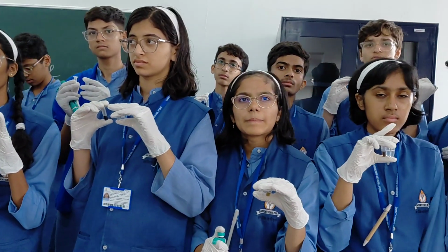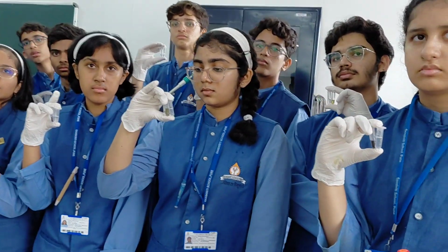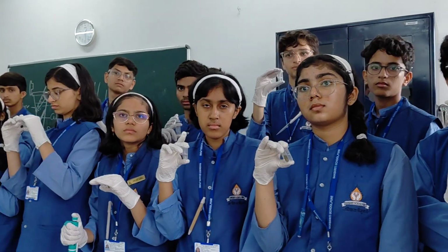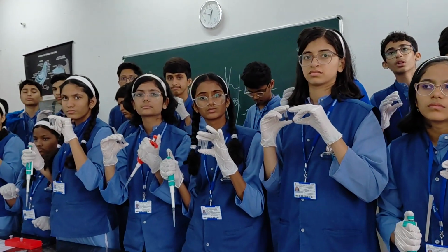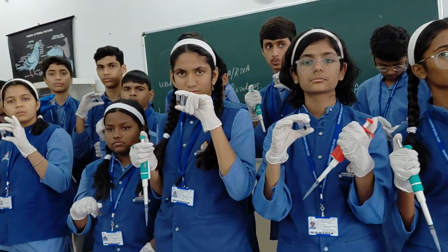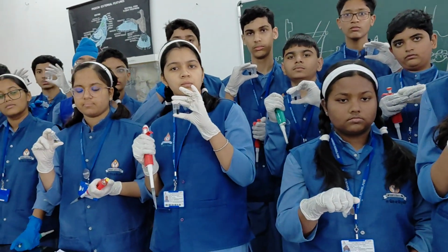So quality is more important in a DNA experiment rather than quantity. 1000 samples you will not use even if you do a PhD. Understand? In 100 times, 200 times everything is finished, all research is done, MSc, PhD passed out. So you need quality DNA extraction.